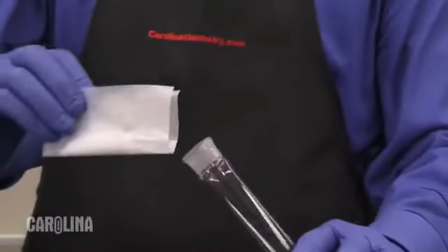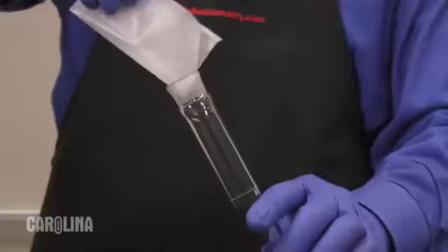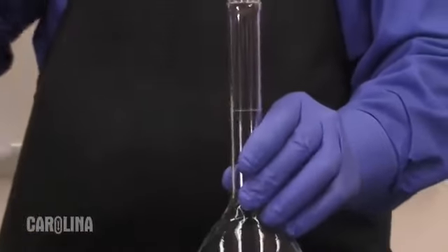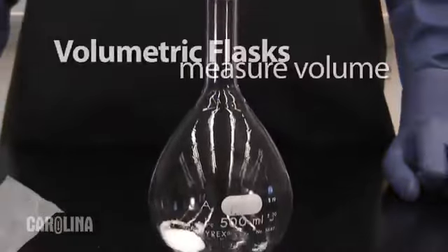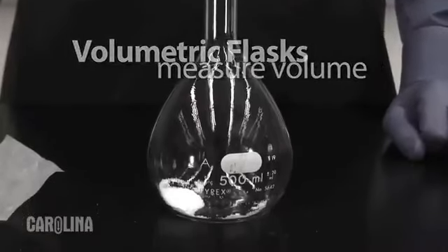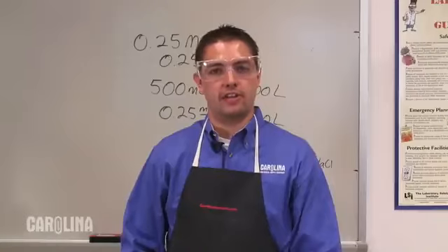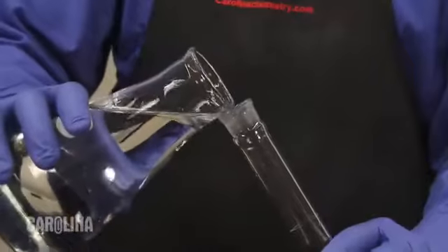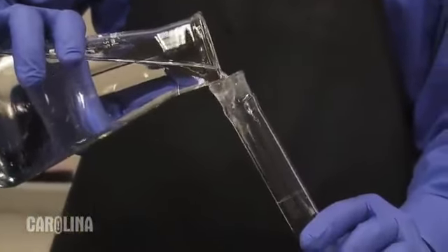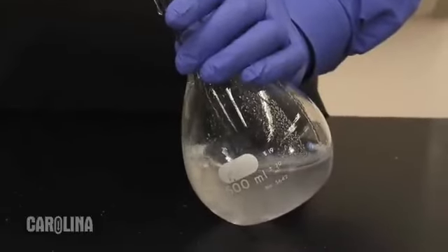Once you've measured out your solid and recorded the exact mass, transfer all of the solid to the appropriate sized volumetric flask. Volumetric flasks are made specifically for this purpose and should be used over other less accurate labware, such as beakers, Erlenmeyer flasks, or graduated cylinders. Here, we just transferred our solute to the 500 milliliter volumetric flask. If any solute remains on the weighing paper, use a spatula or a small amount of water to transfer the remaining salt. Next, add enough water so that the bulb area at the bottom of the flask is approximately half full. This will give you enough room to swirl the liquid, allowing the solute to completely dissolve.